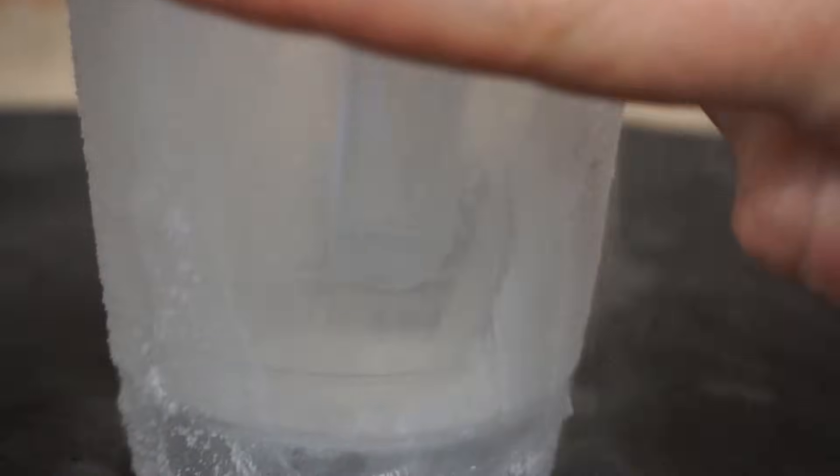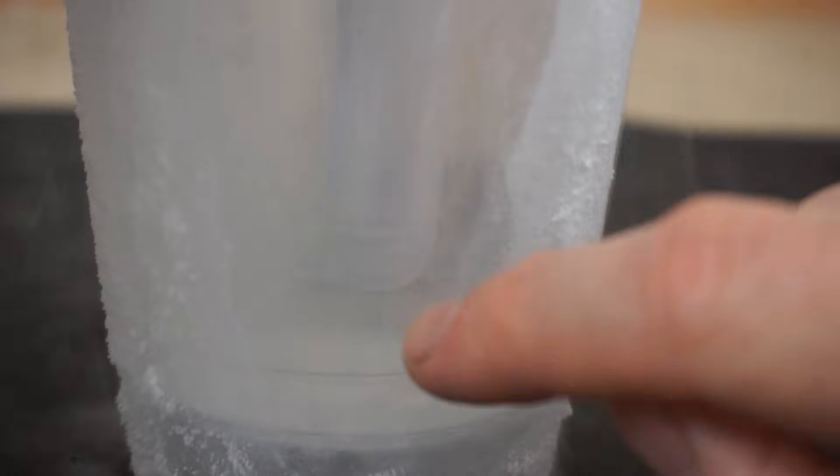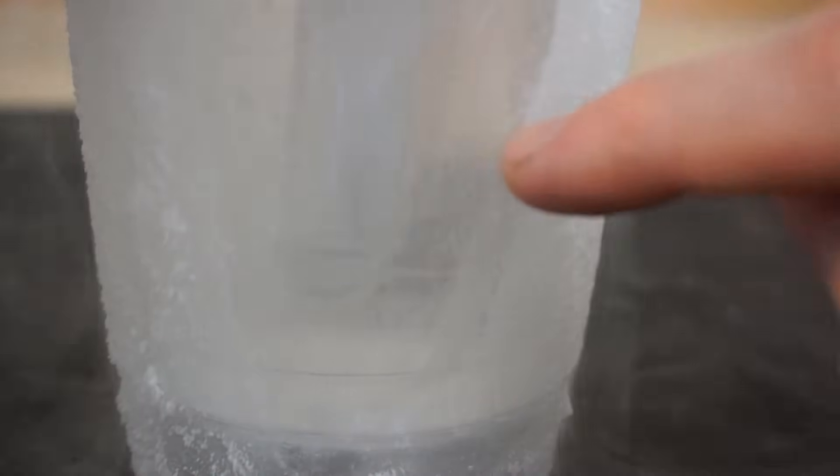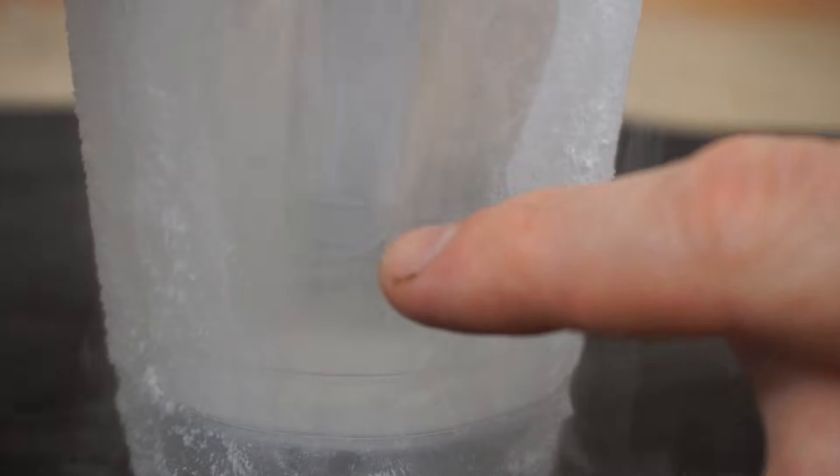Okay, you can see the liquid air at the bottom of the test tube in the liquid nitrogen. If I take it out it'll quickly frost up, so I'm leaving it in there. So that is liquid oxygen, liquid nitrogen, and I don't see any solids yet but there should be a little bit of solid in there - that's carbon dioxide.